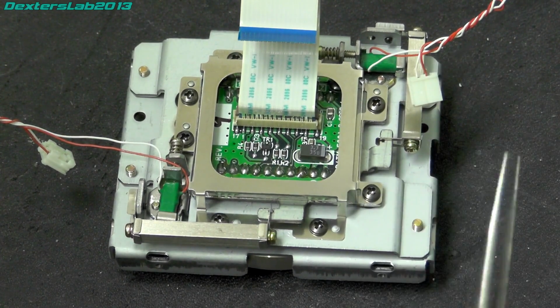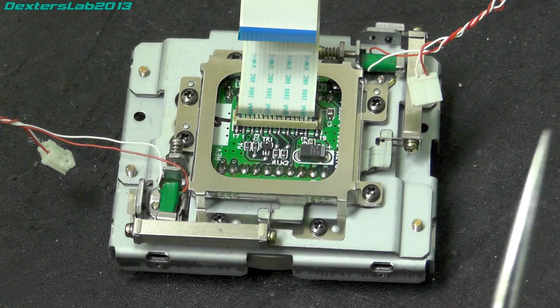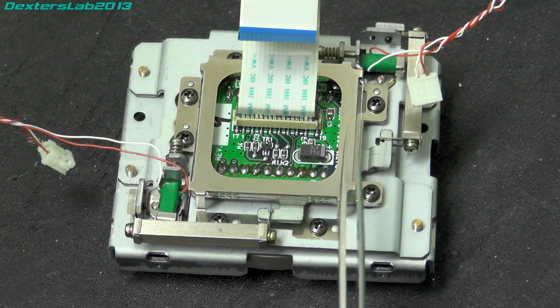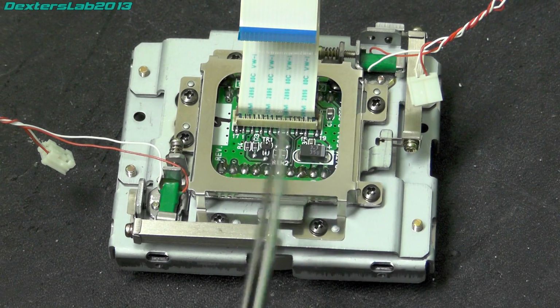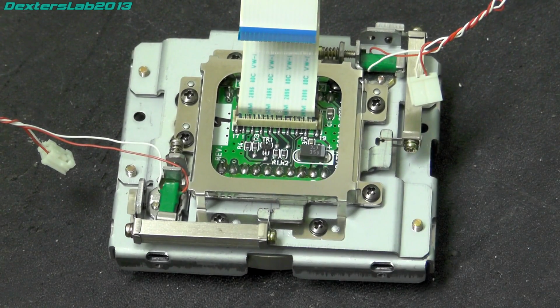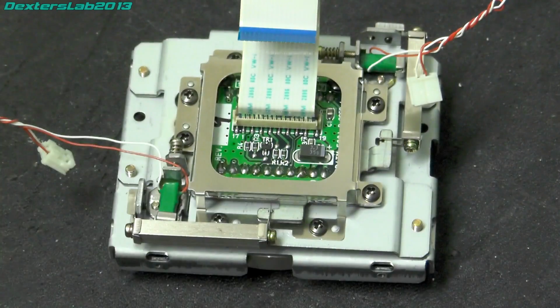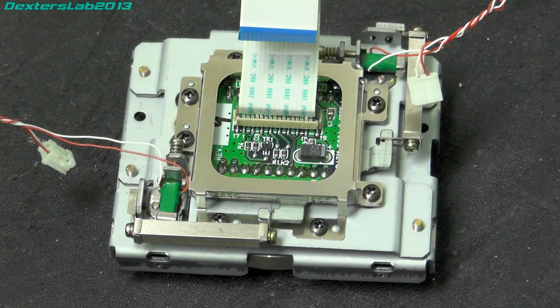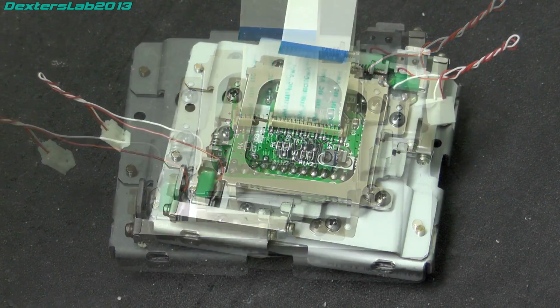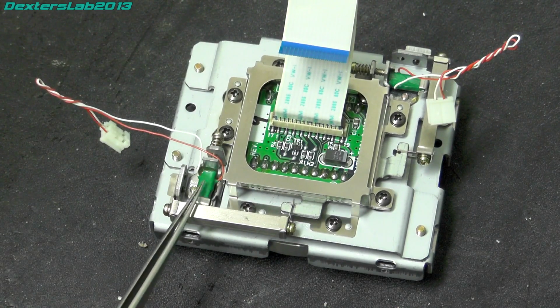So yeah, obviously what's going to happen here is the software is going to put this into the center position, take a picture, move it that way, take another, then pull it down, take another, release that side so it's in the center, and then work its way around, take all those nine individual images and then interpolate those together to create that 12 megapixel picture.